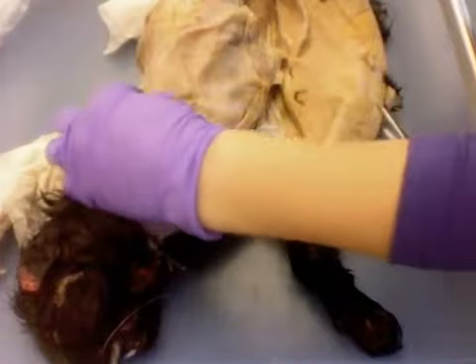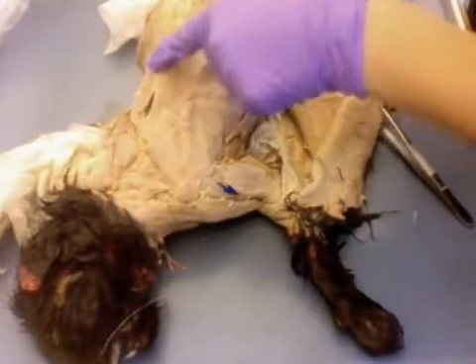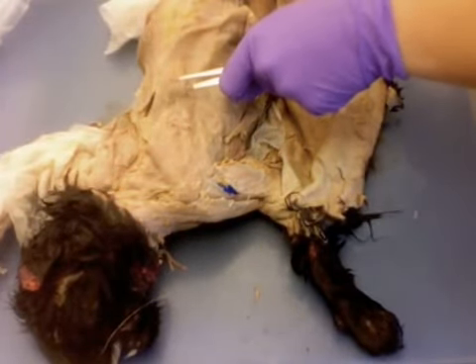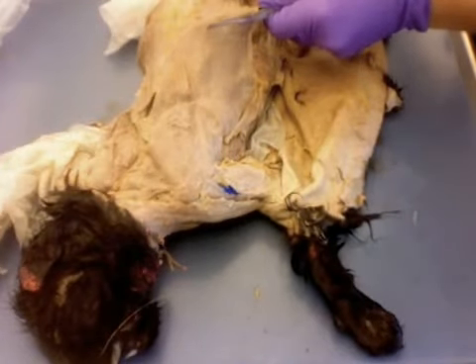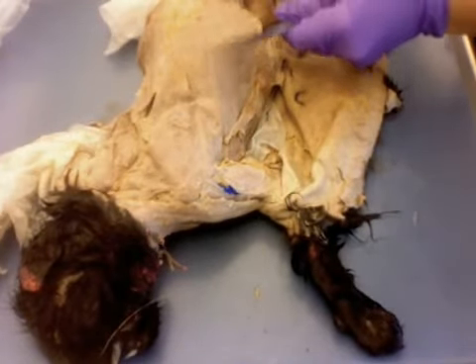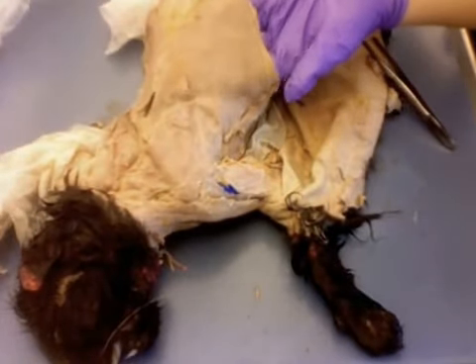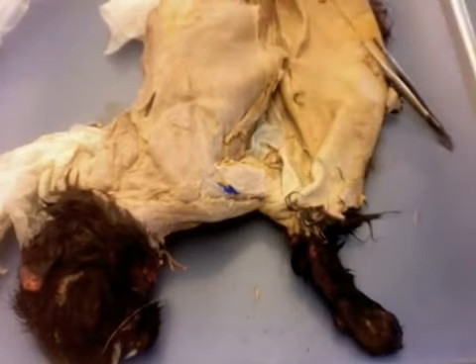So it forms a V extending down along the spine there. Okay, so one more time, our spinotrapezius right here. And then finally, latissimus dorsi on both sides again. So these big, very thin flaps of muscle on the back, latissimus dorsi.